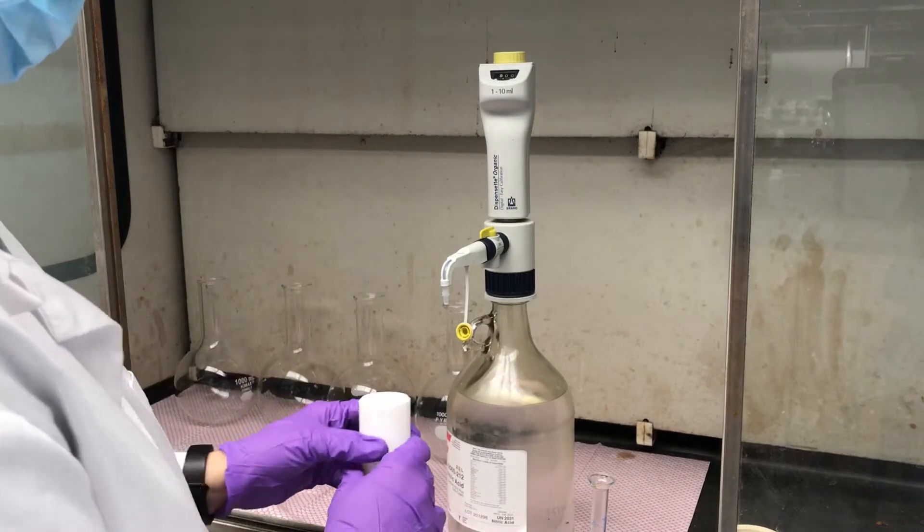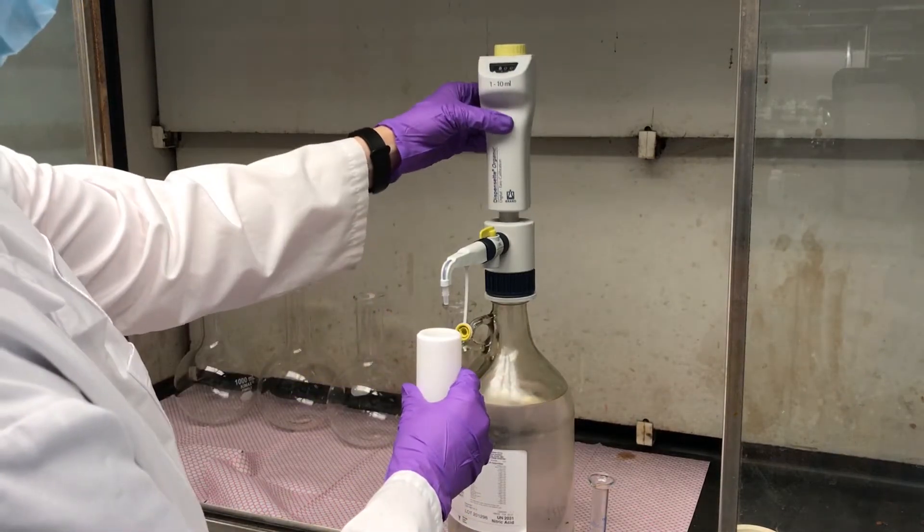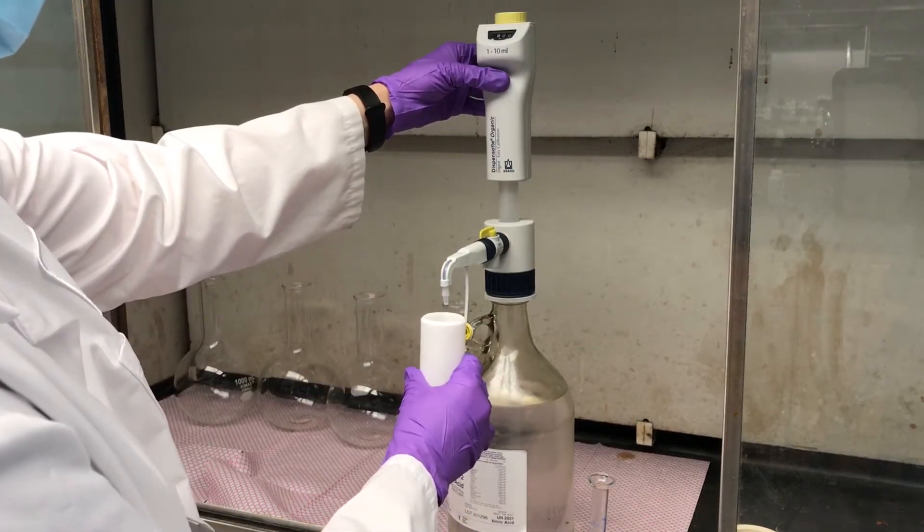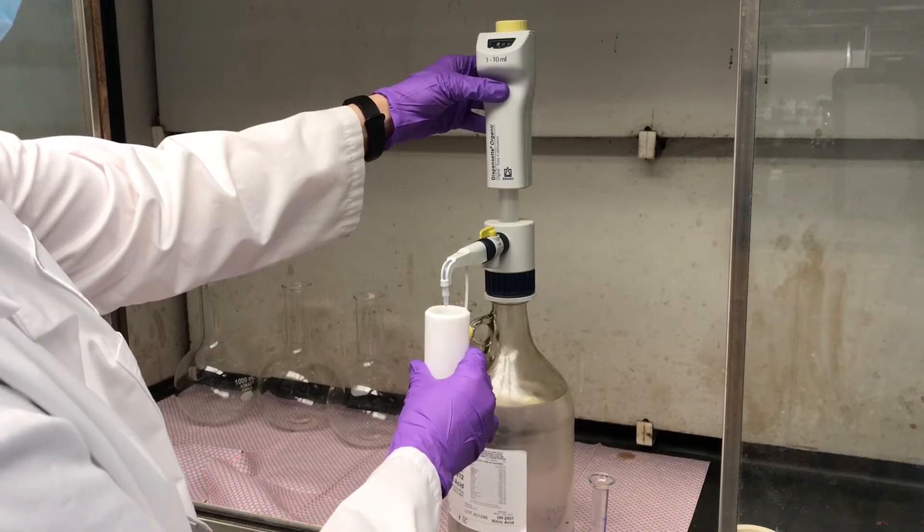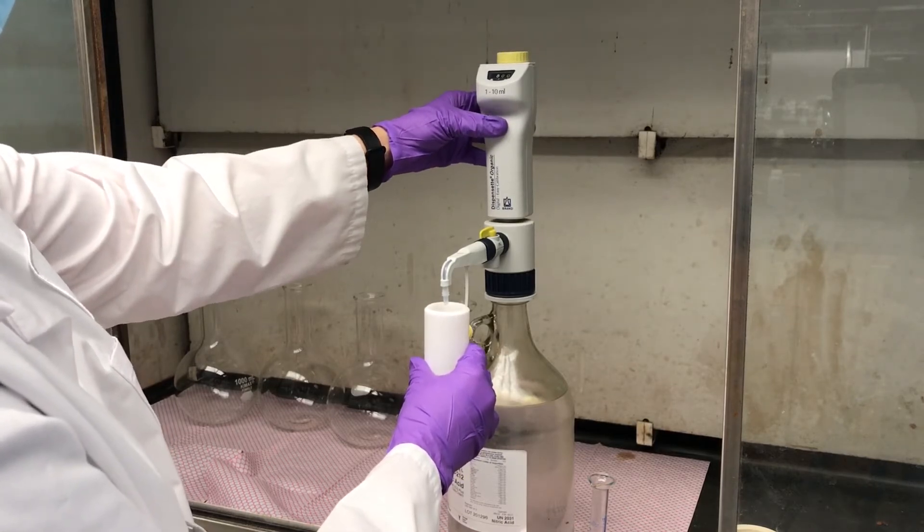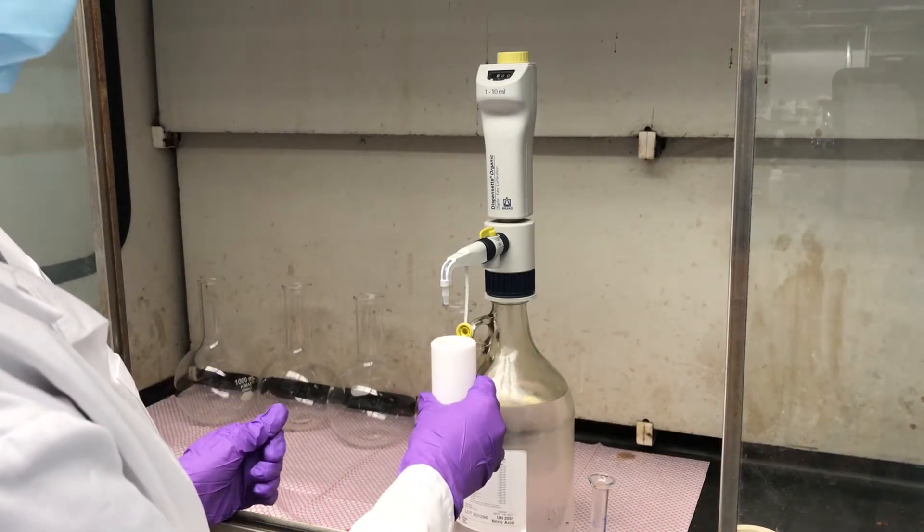You do not need to wet the dispenser. So the way this works is you lift up on this part of the dispenser and just gently push down and five milliliters will dispense.